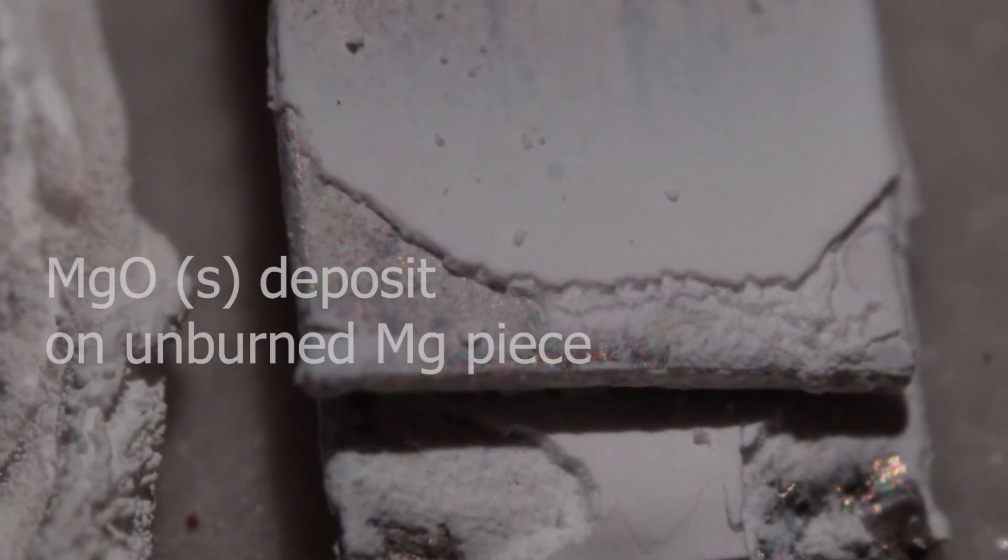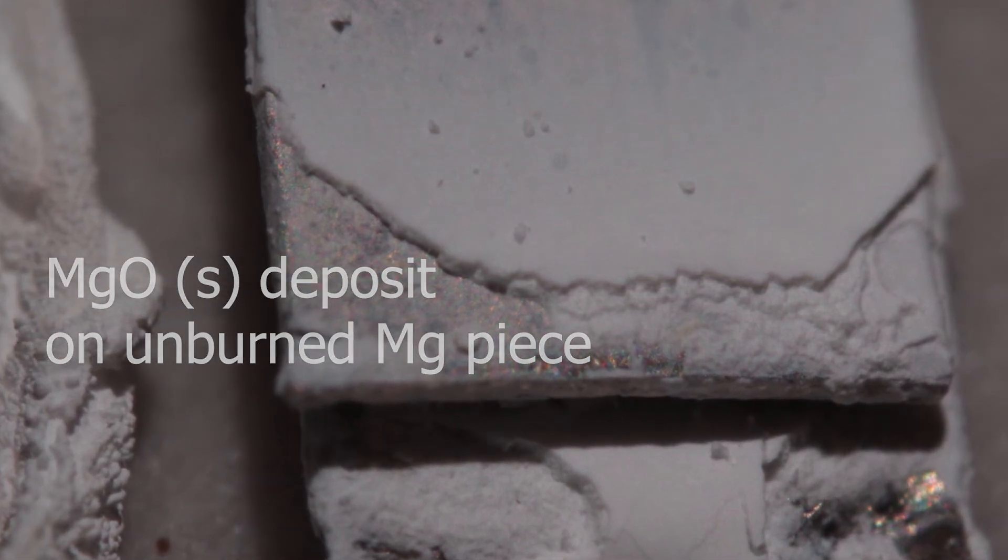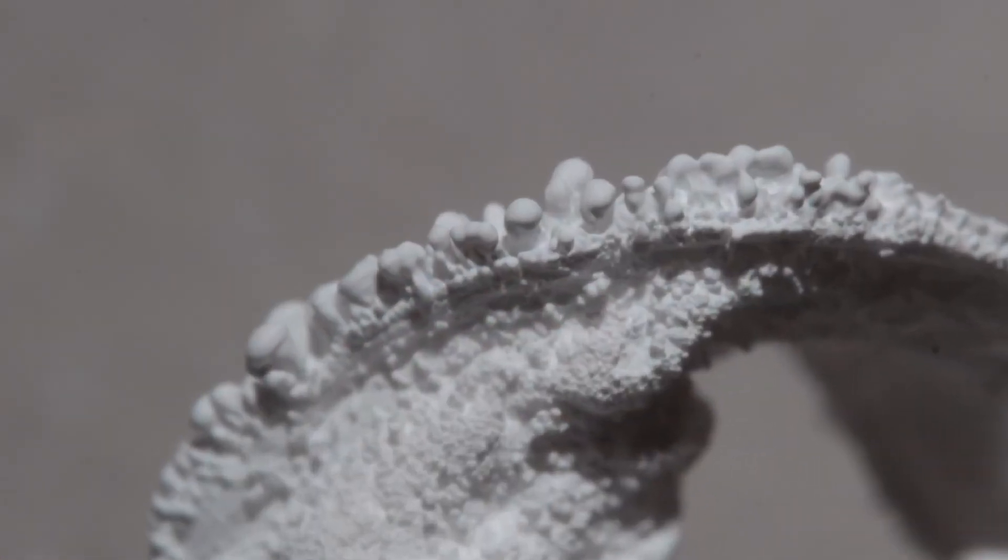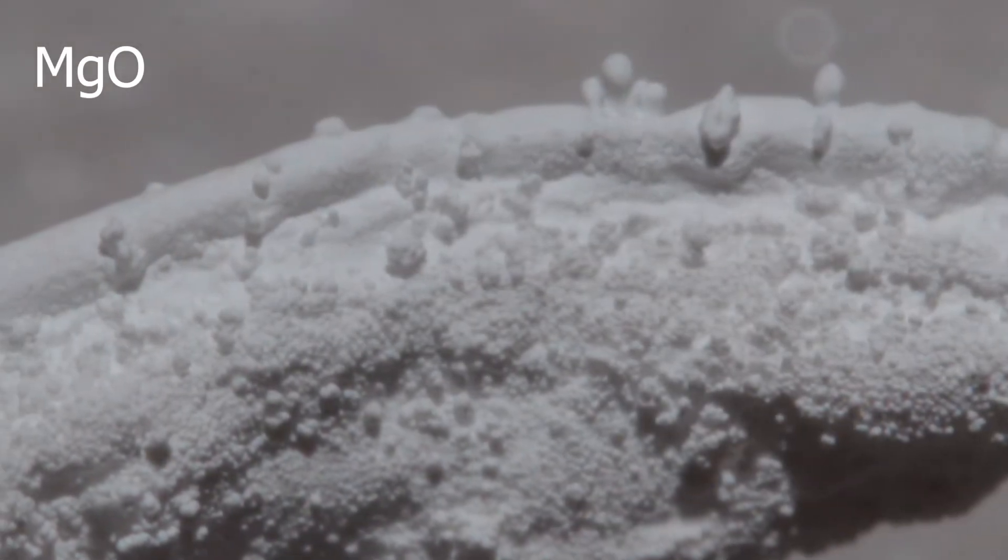Here are a few macro photos. That's how white smoke deposits on any pieces of solid which are around. These structures are again a result of deposition of magnesium oxide, this white smoke.